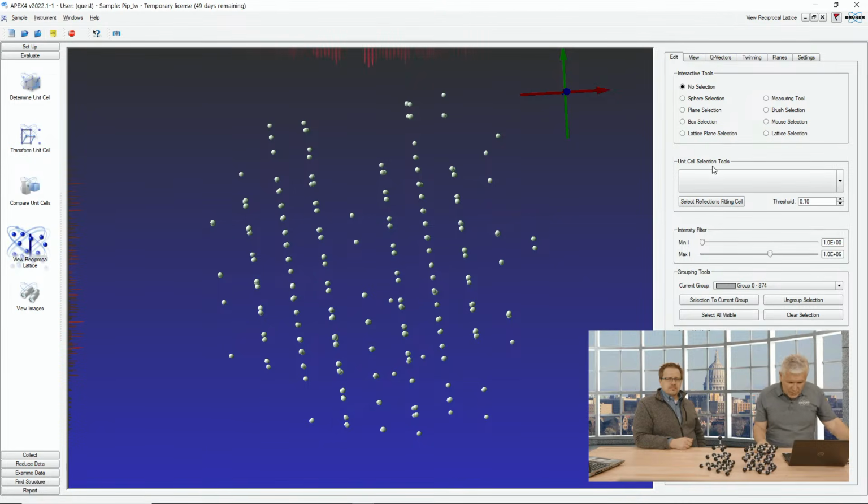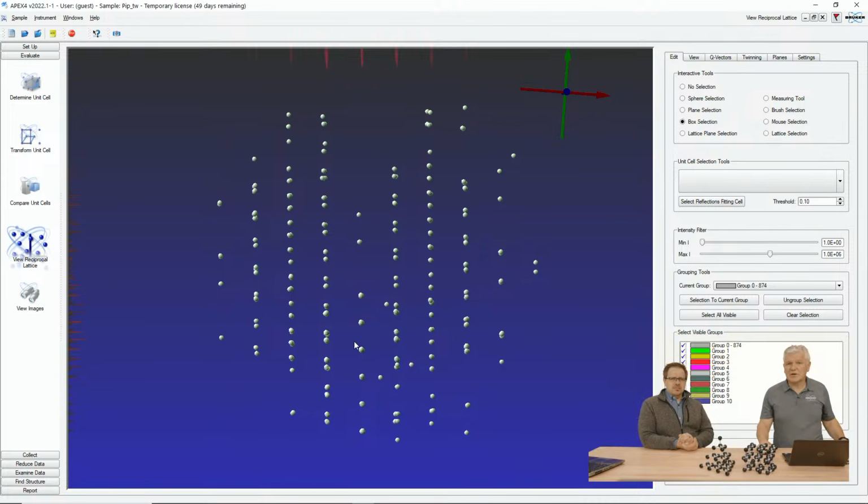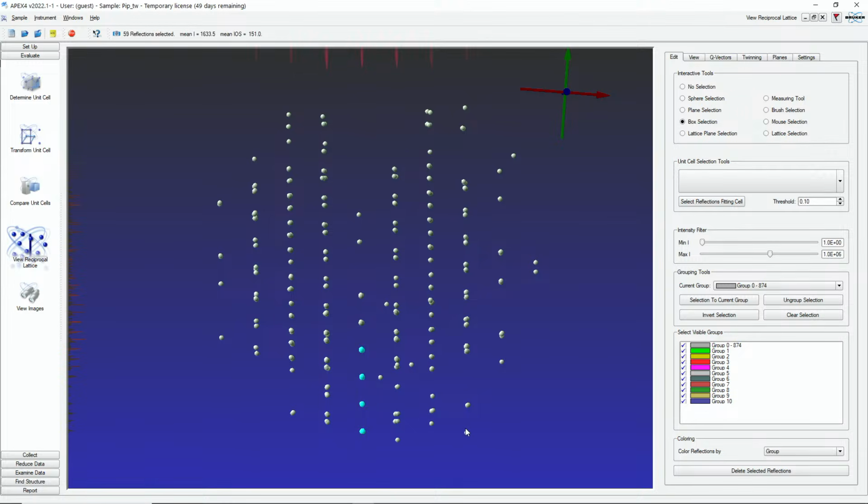So what I will do is use a box selection in this case, and let me try to orient this a little better. As we said, we know that in the middle here, everything overlaps. They're well aligned, so that certainly belongs to one domain. I will clear the selection again. And if you could turn off the live feed, then we see the tools a little better. So we select these, and then we know, because we have pairs here, every second reflection belongs to a domain.